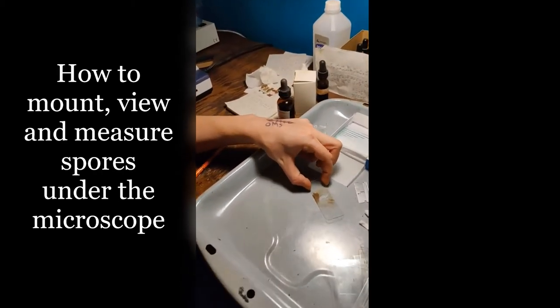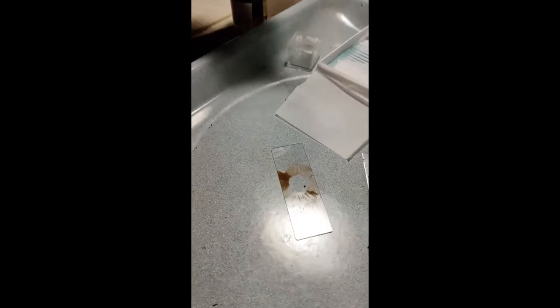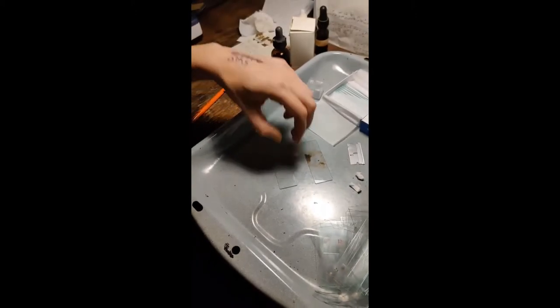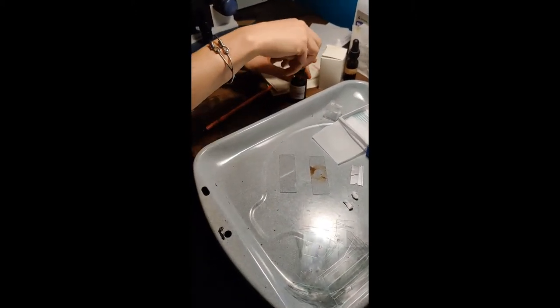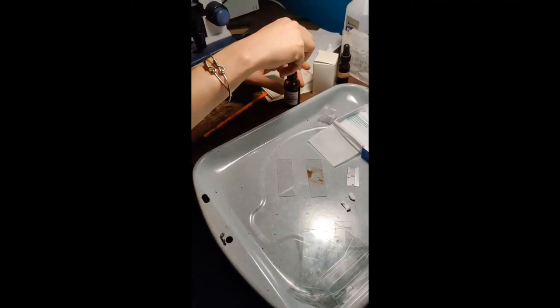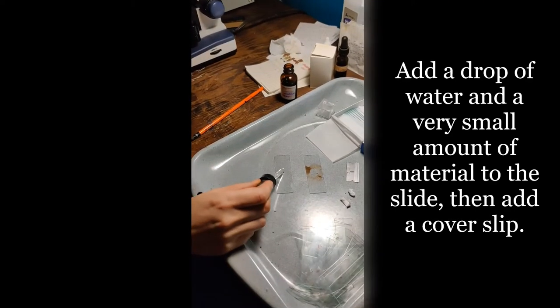Here I have a spore print. This is from an Agaricus that I did on a slide, and I'm going to put some of those spores under the microscope. So first I've got water and I put a drop of water on the slide.